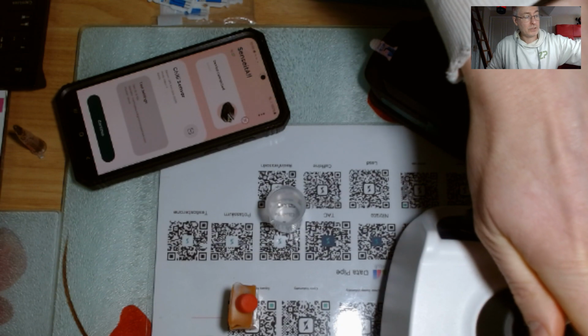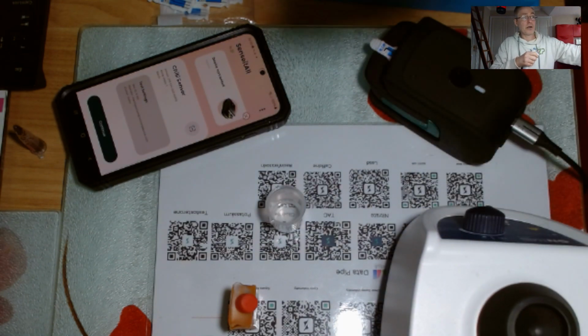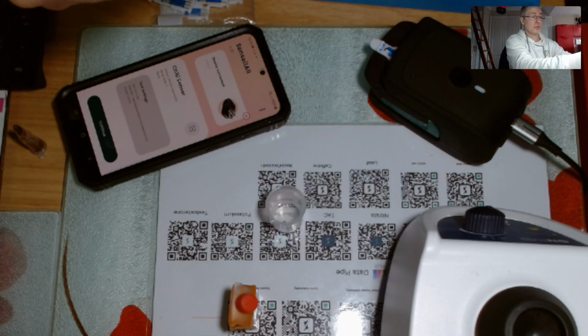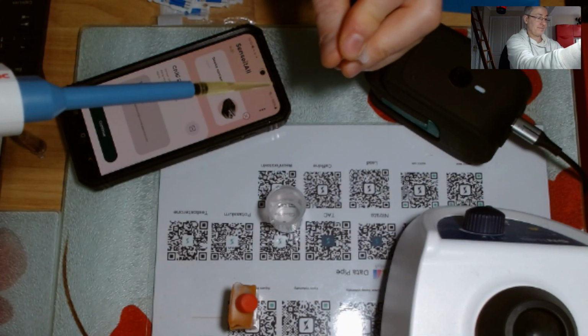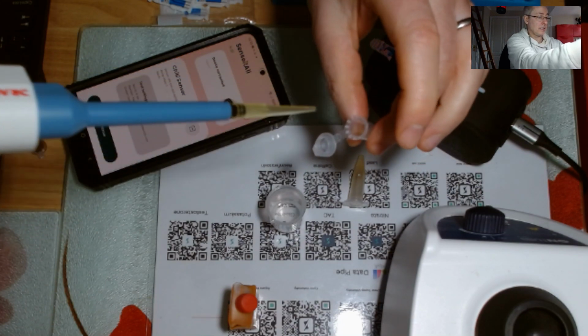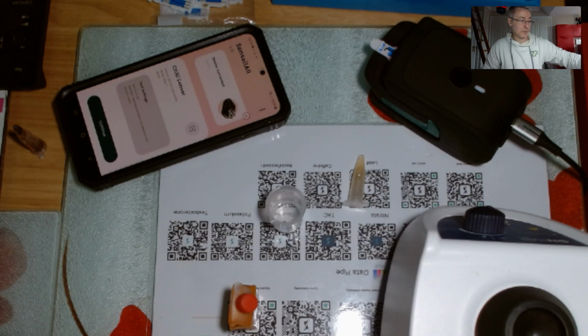What I'm showing you is a strategy for troubleshooting yourself in real time. And I'm actually not using that much liquid. So there we are, I've just vortexed it to homogenize it. Now I'm going to take 100 microliters, like that. I'll put it into a clean tube, like that. I'm going to be careful when I put this tube down. I'm going to just move this right out of my way so I don't pick it up by accident, because that can happen.